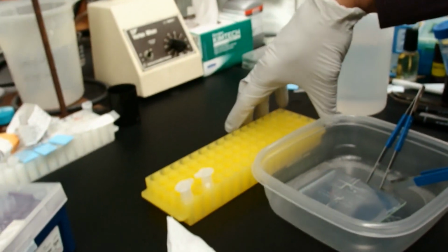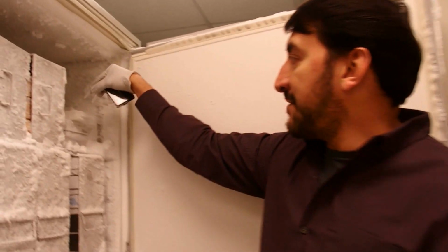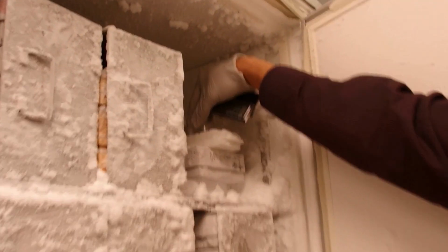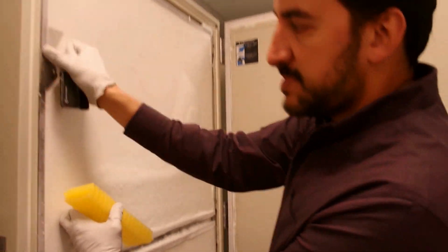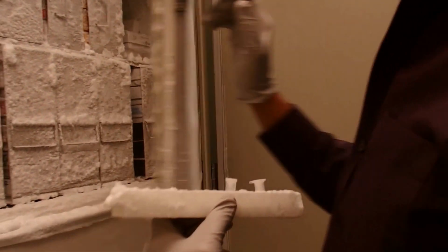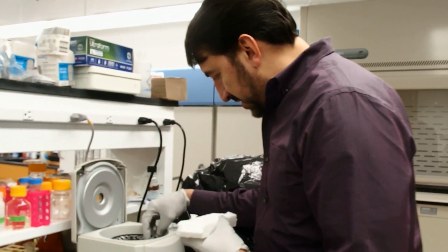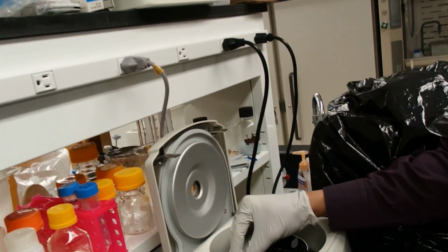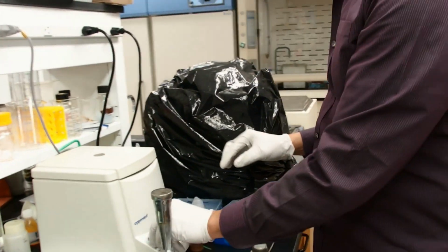So I'm going to put this in minus 80. I already have a rack that stays in the minus 80. It's already cold. I'm going to put that in there for five minutes. Five minutes is up. I'm going to take this whole rack over to the centrifuge quickly. We cannot allow it to thaw out. Immediately we need to get these into the centrifuge. And we'll spin for three minutes, maximum speed. Three minutes is up.